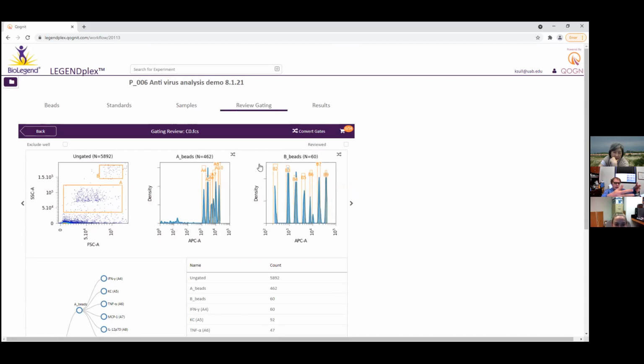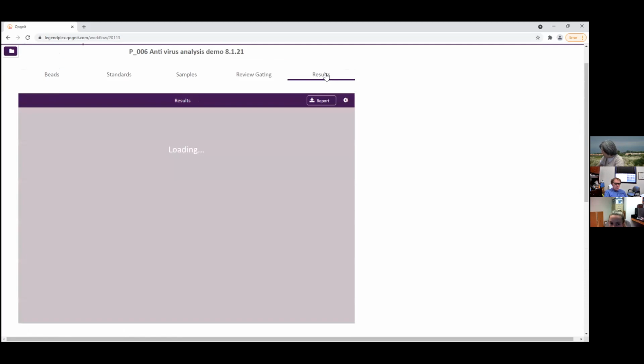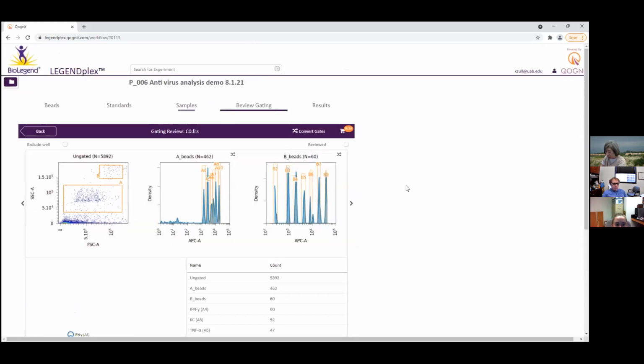Yeah, no problem. So, I mean, this is what we wanted to begin with. And it's nice because now I know how to adjust it correctly. I know what all these things are, and now I know where the numbers are coming from when you go to results. You can go back again to the histogram.